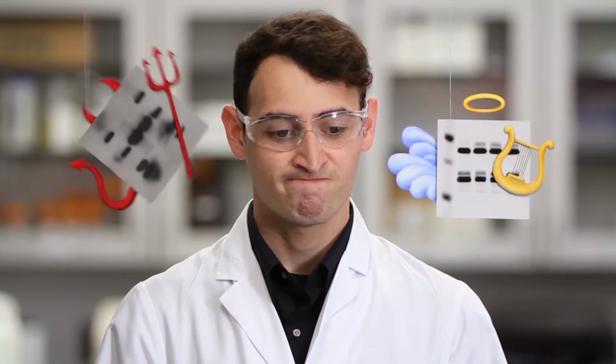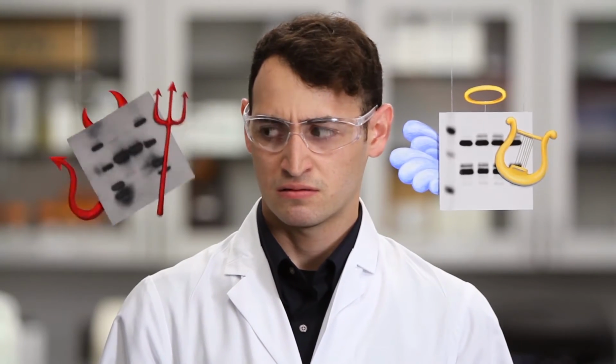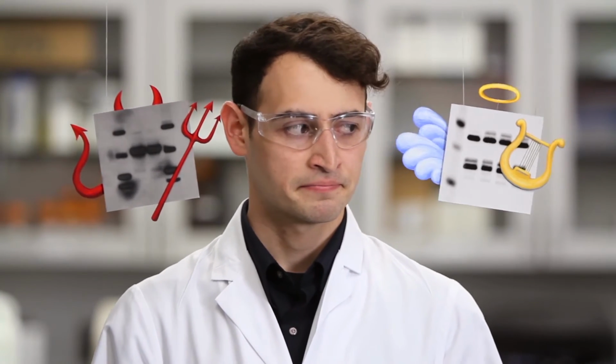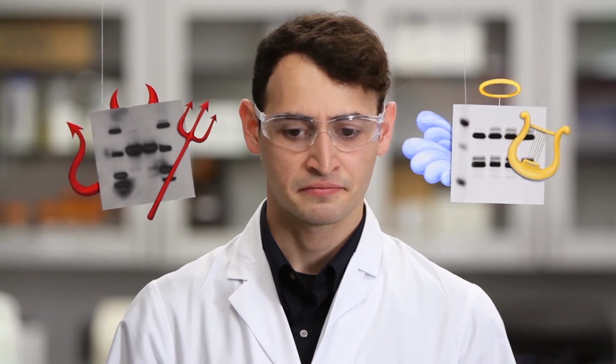We also need to consider... It's good enough. Nobody needs to know if our proteins and membranes and buffers are validated. It's worth it. How confident are you in your Western blots?